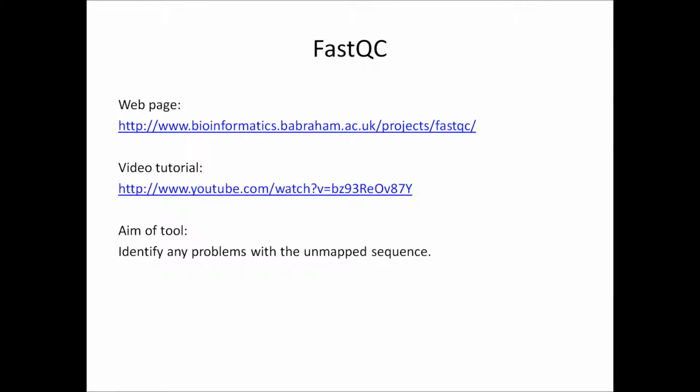Before I start in earnest, here's just a couple of helpful pieces of information about fastQC. You can find the project web page at this link here, and Simon Andrews, the main author of the tool, has created a YouTube video which explains the major concept of using the tool. So the main aim of fastQC is to identify any problems in the unmapped sequence that we've got from the sequencer, and that will then allow us to make decisions on whether to use the data or not, or whether we can recover the data if there is a problem.